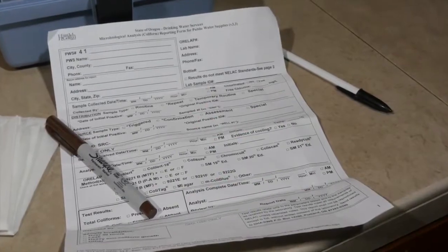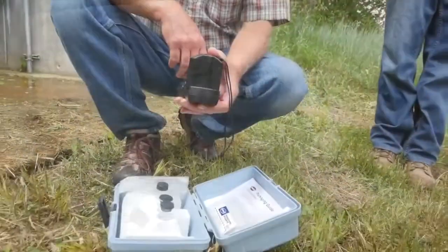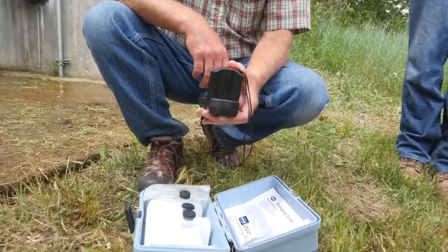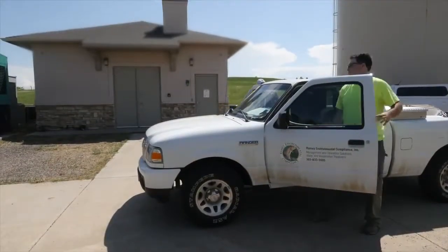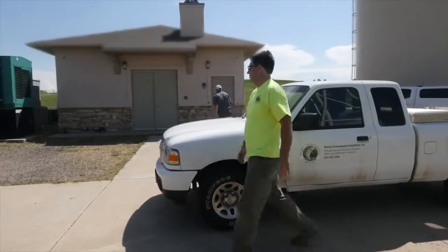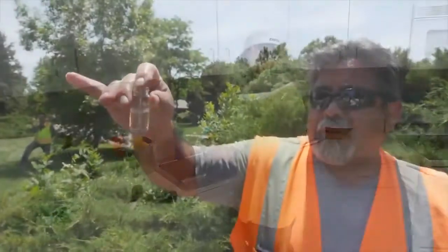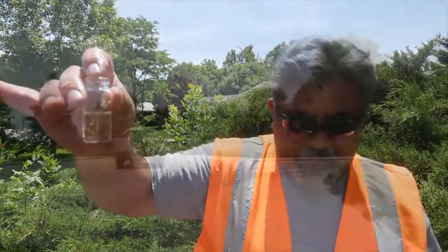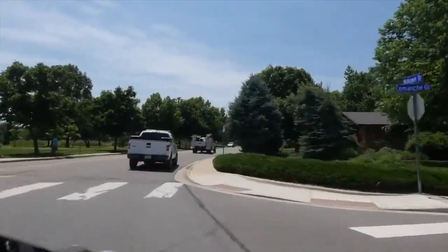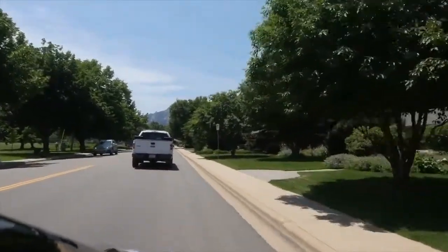Chlorine residual may be measured for compliance or non-compliance purposes. While the analysis will remain the same, how you collect the sample may differ. Compliance samples are typically taken at the entry point to the distribution system. Compliance samples are also taken within the distribution system at the same time and location as total coliform samples. Typically, these samples are taken within a customer's home or at a dedicated sampling tap.